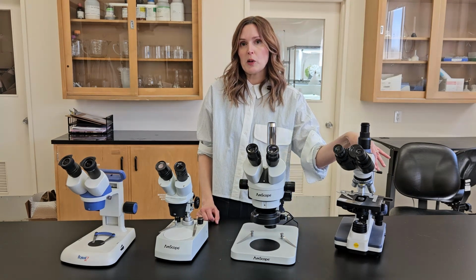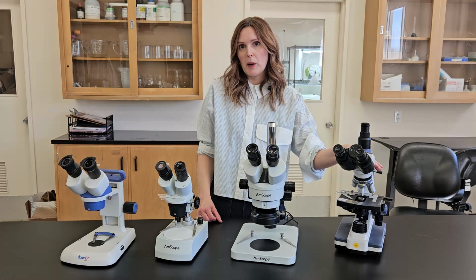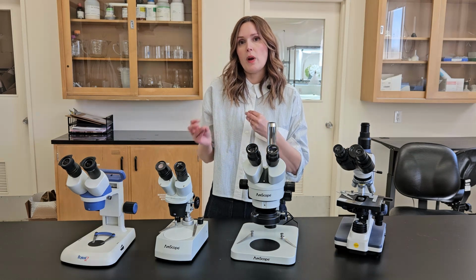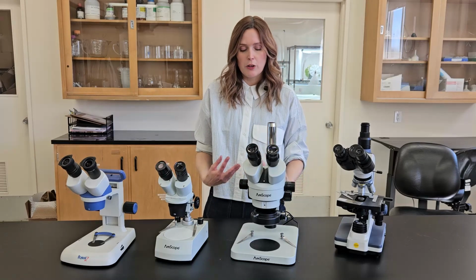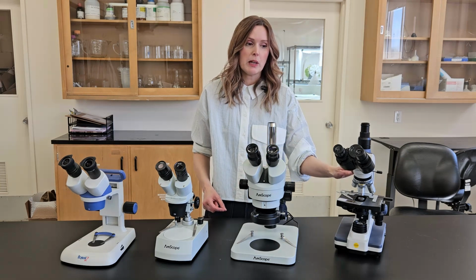So I do have growers purchasing this now who are struggling with things like Thrips parvispinus or Thrips palmi, so that they can accurately ID which thrips they have, because to get to the nitty-gritty between some of the thrips species, as we talk about in our thrips workshop, you actually need to look at really fine features where you need a compound scope.